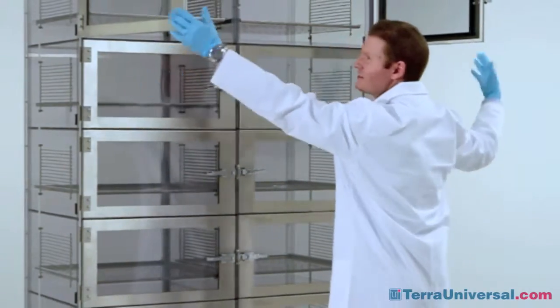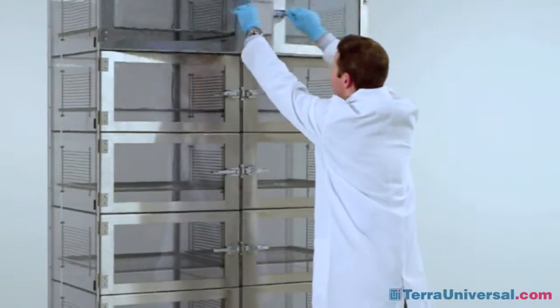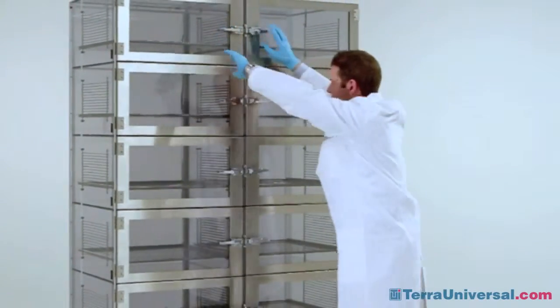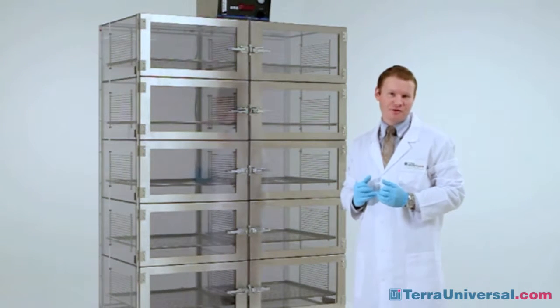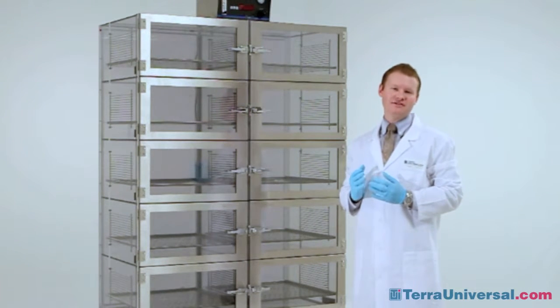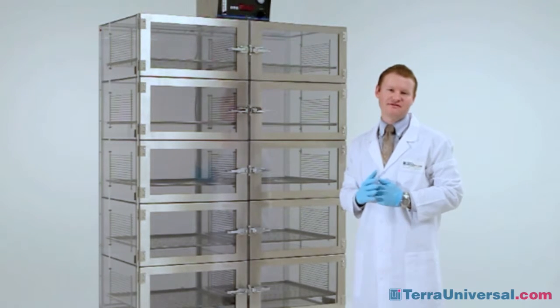If your stand is level and the door latches are centered, then your doors are properly aligned. You're ready to turn on your dual purge nitro watch system and begin storage of your moisture sensitive samples.